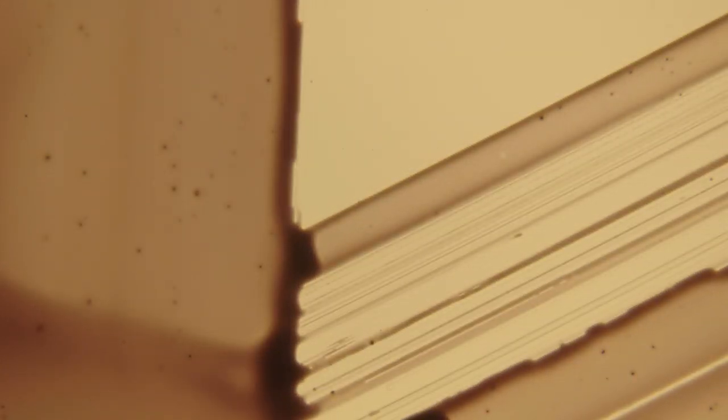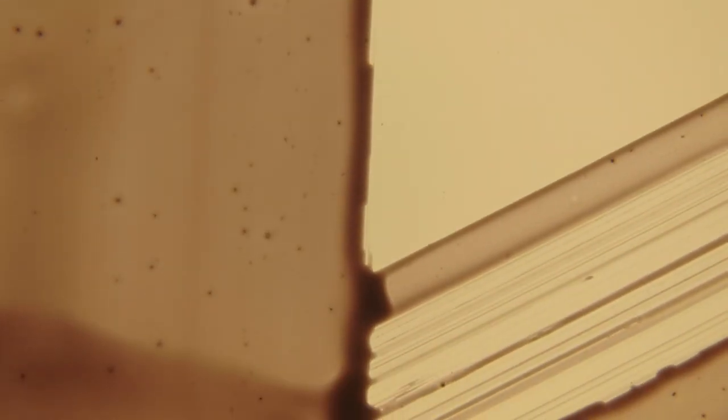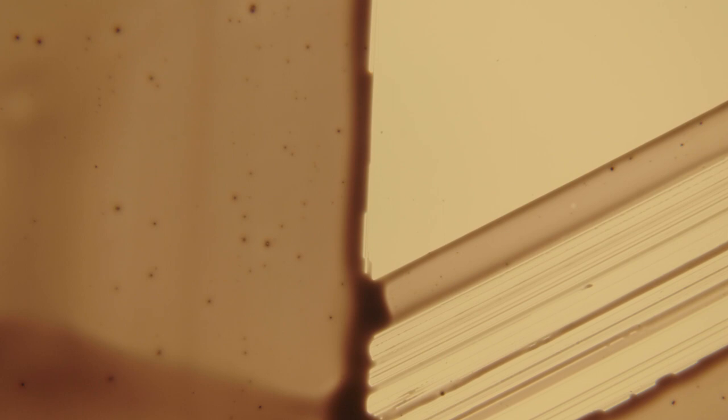Here we now have another image in fine focus. If we move the XY controller we can see the image move, so this is something on the slide and we can now move on to the next step in the setup process.